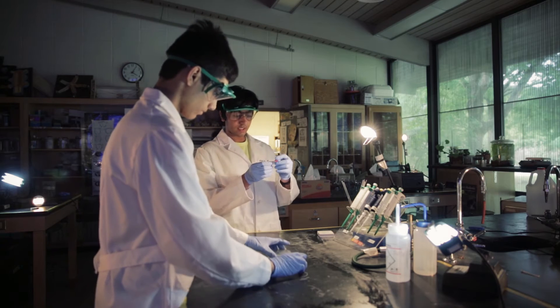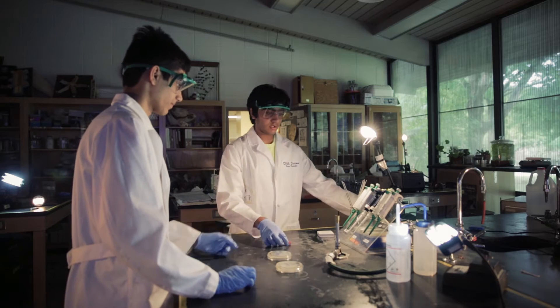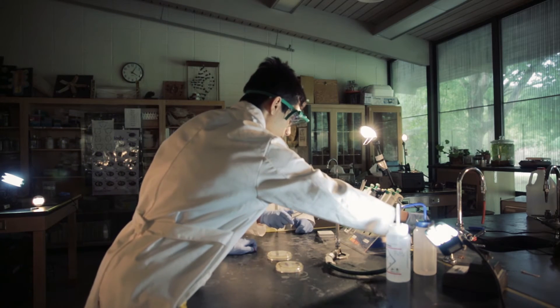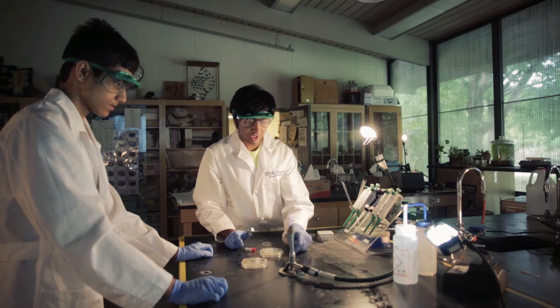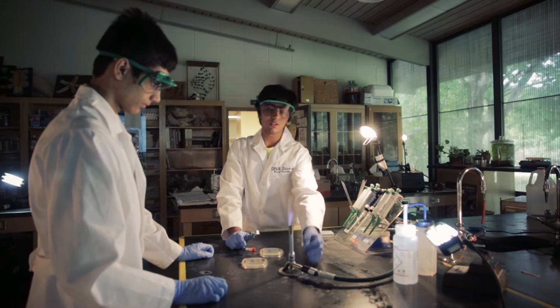Okay, and this is our actual part A. So for this we're going to have to light a flame. Turn on the gas. Get it right over here. And we have to make sure we can get it just right.